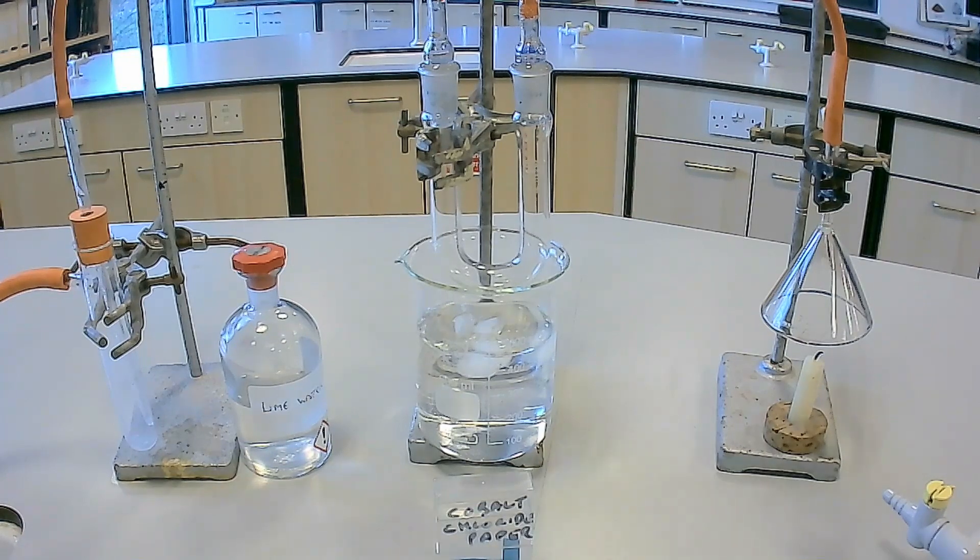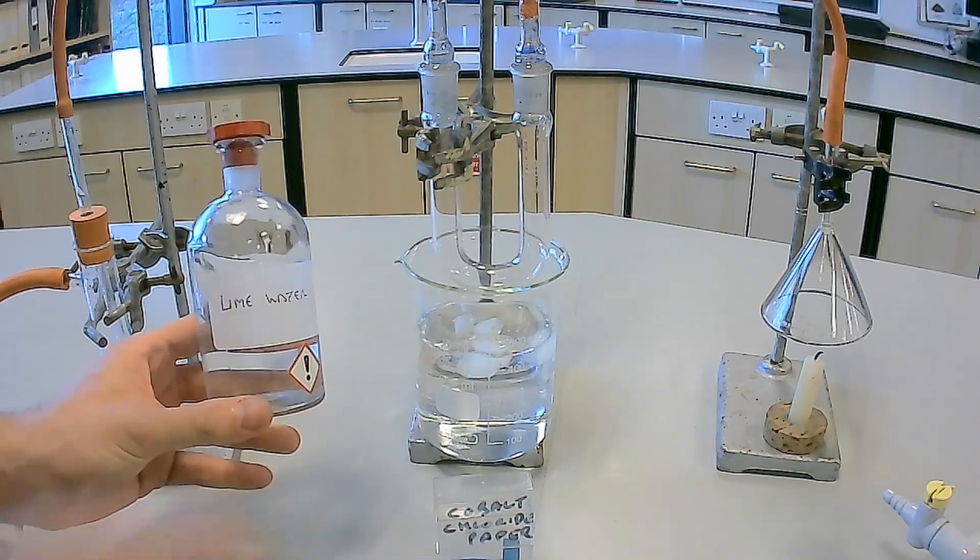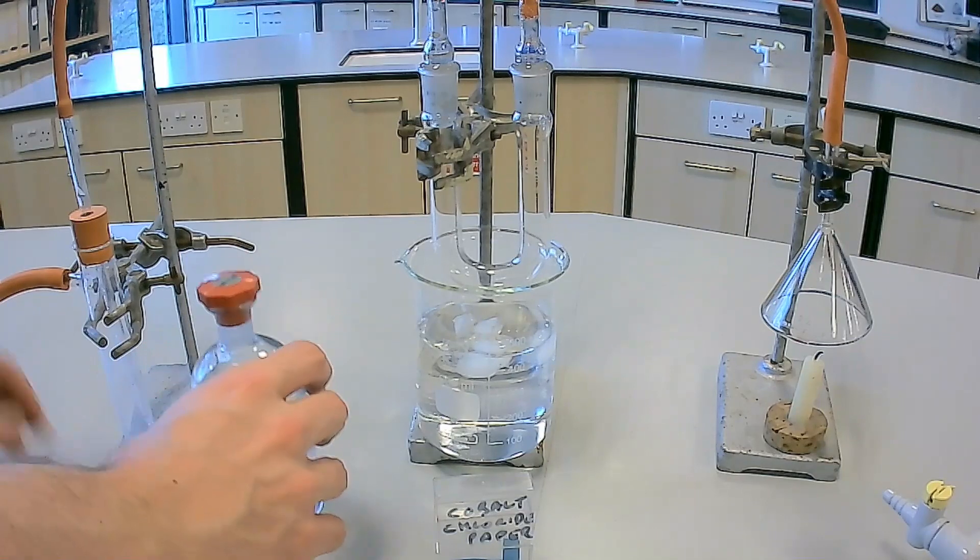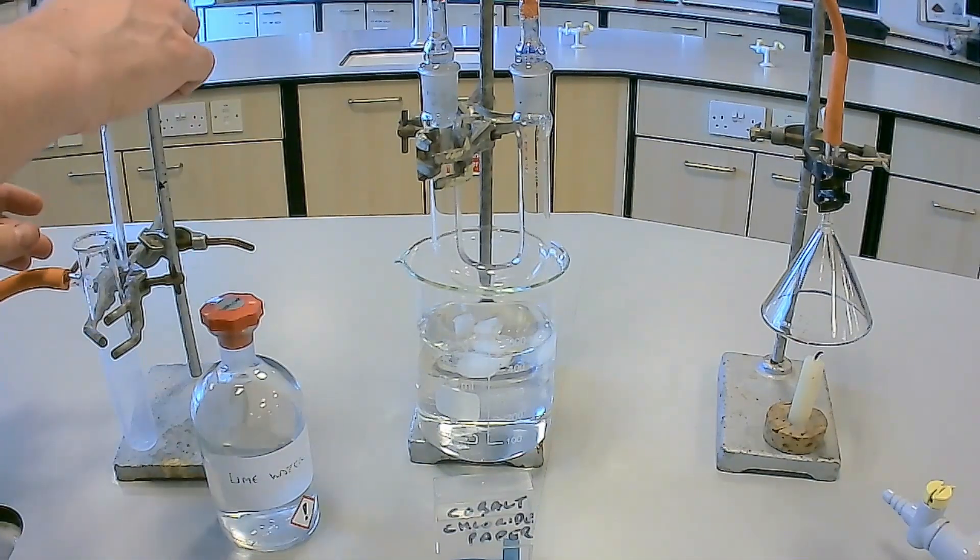In this experiment, we will be burning a candle made from a compound containing only carbon and hydrogen atoms and observing the products of combustion.